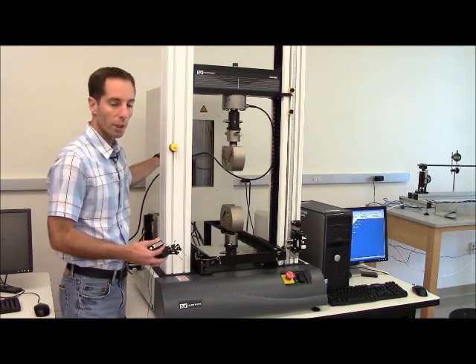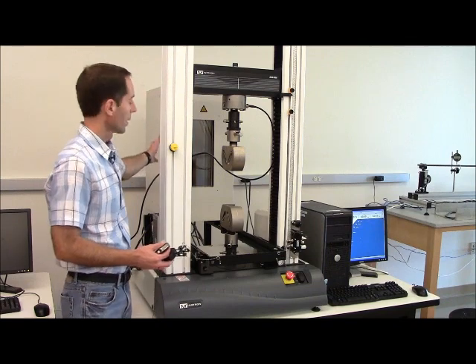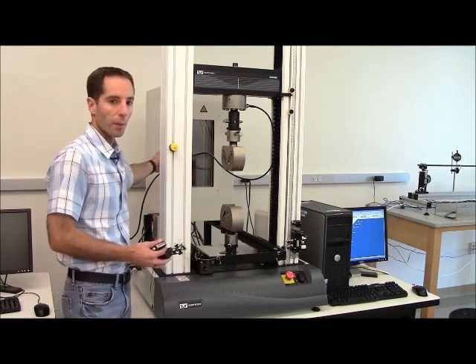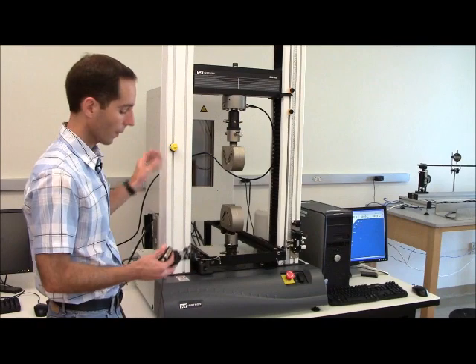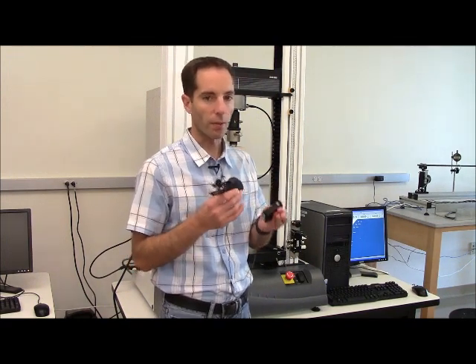Back behind, we have our environmental chamber, and I'll go over that more in detail in that particular video. It is on a track, allowing the chamber to slide forward. I'm holding an extensometer. The extensometer clips onto a sample, usually in a tensile test, and it directly reads strain. So it starts off with an original gauge length of one inch, and as it reads the displacement, it automatically converts it to strain, and we get a direct strain value.